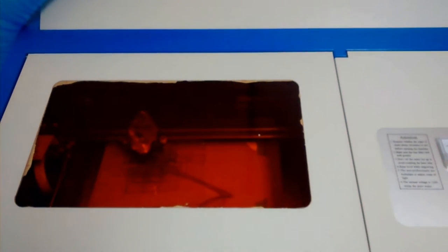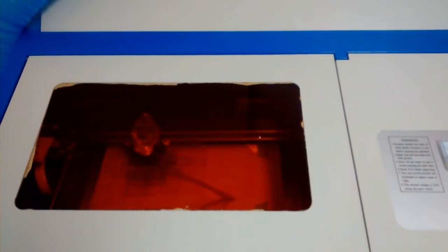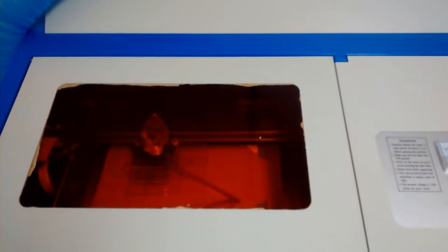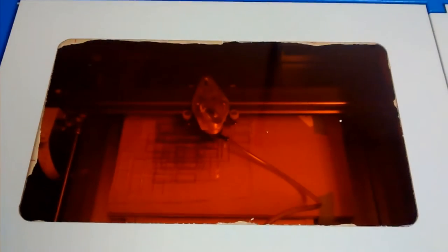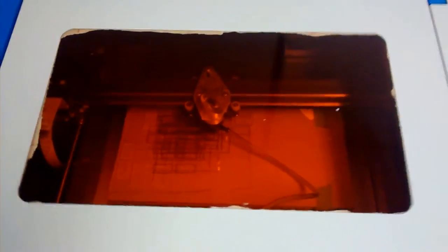Then you hit go on the computer and you can see the laser start to cut. When you see those bright flashes those are the backing paper below the acrylic burning away. So that means that we've got a full through cut when you see that.